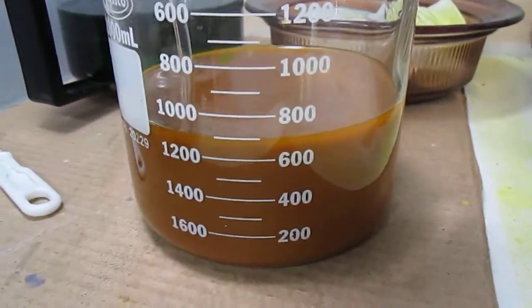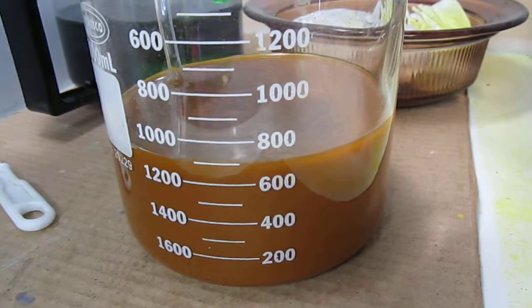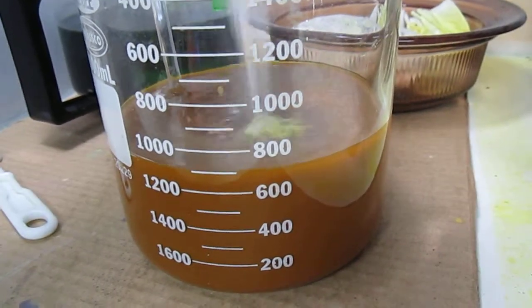The solution still has plenty of orange. It means gold is still in solution.